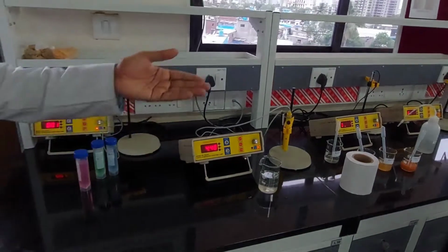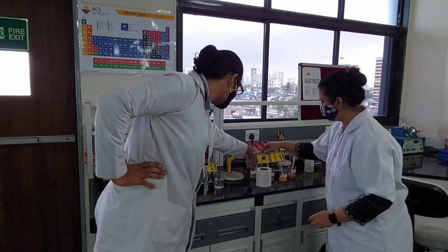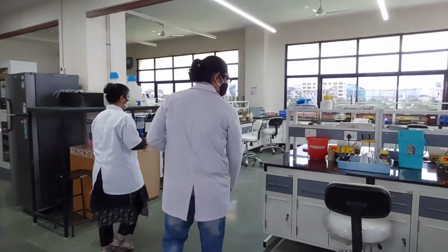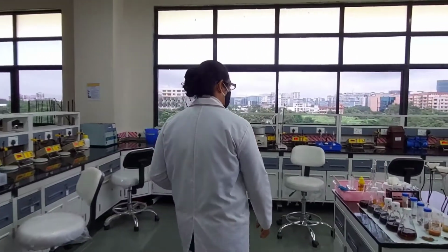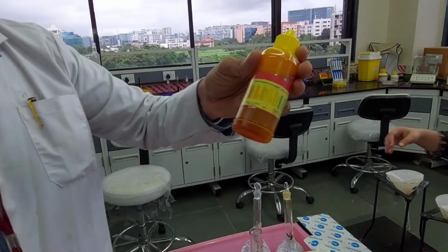Right. You can take one of the samples for demonstration purposes. What is that? Sand. Let's take sand. It's a clear solution. So now we are also measuring the pH using this liquid indicator, the universal pH liquid indicator. Can you see?